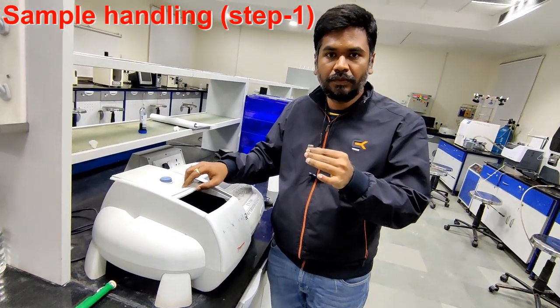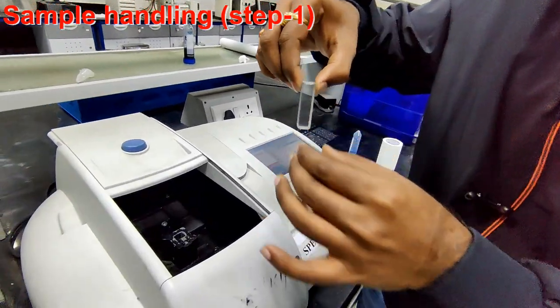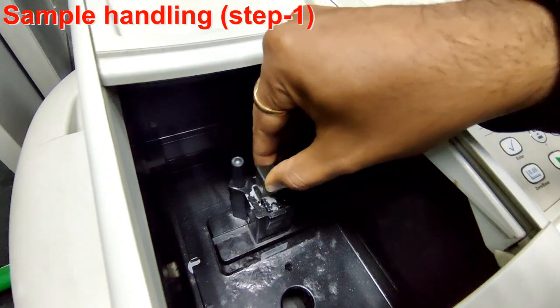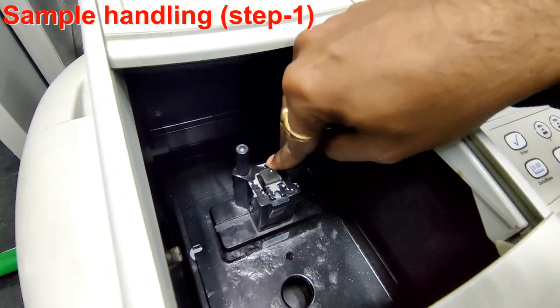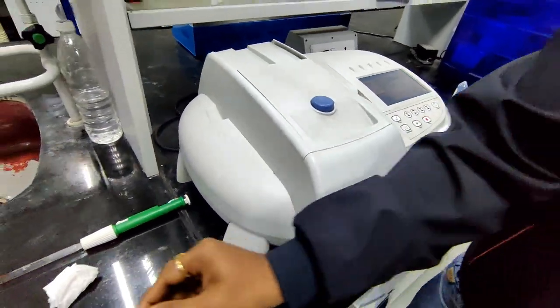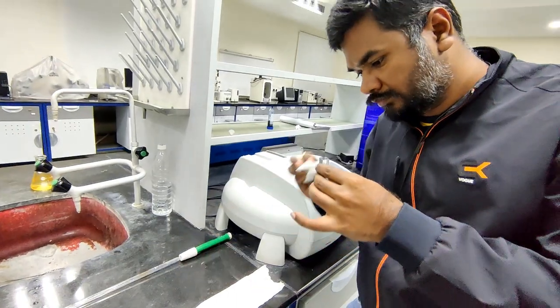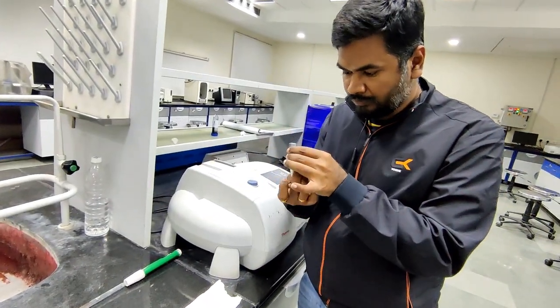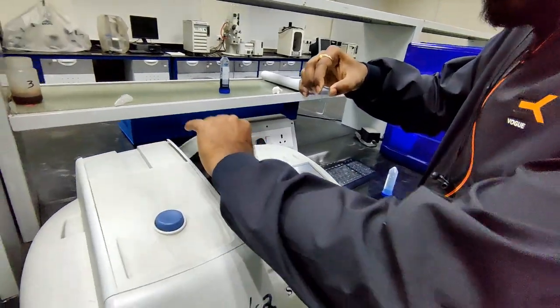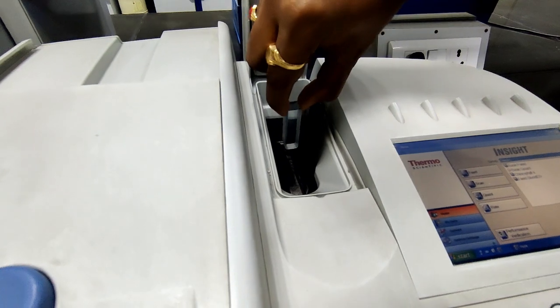Now I'm placing these cuvettes inside the chamber. I'm placing one cuvette in this direction, and I'm closing this chamber. Then I'm taking one more cuvette, and I'm placing it in this way.